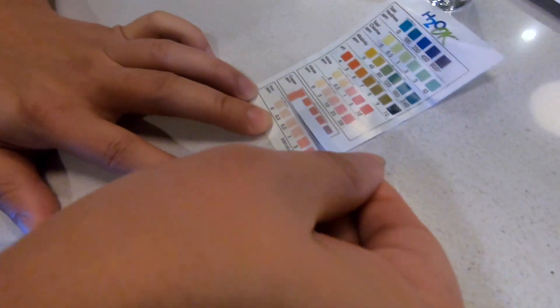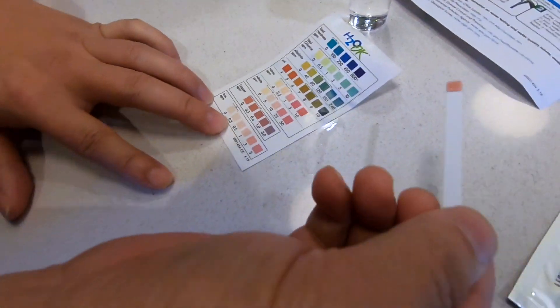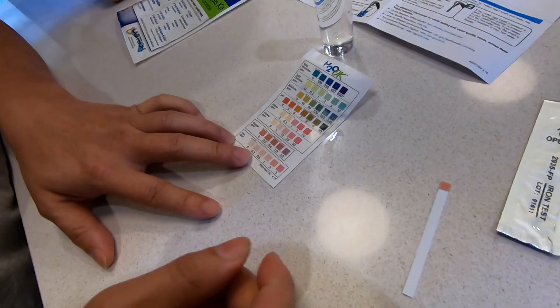So we have no copper. I guess that's good. After 30 seconds this is no good and that's it for our copper test.